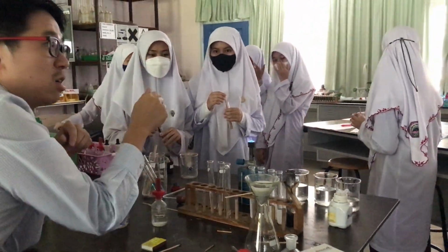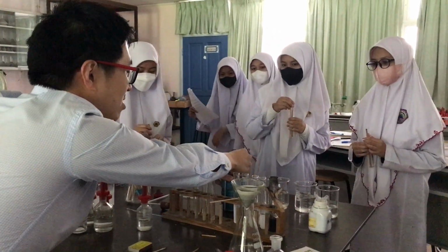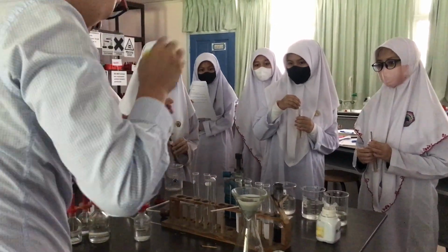Okay. This is called the flame test. How do you do the flame test? First of all, can you use, crap. Can I get another lighter?